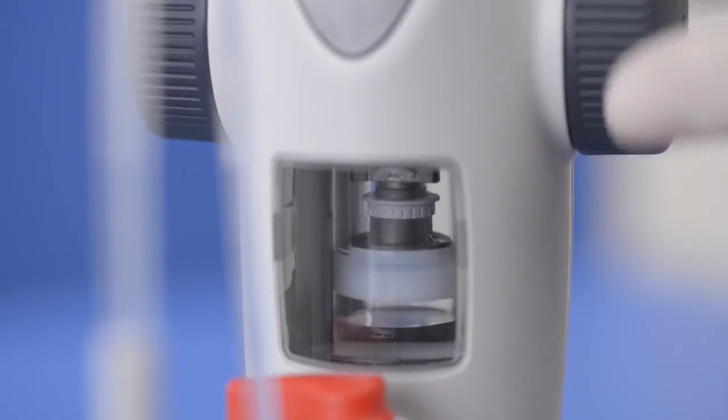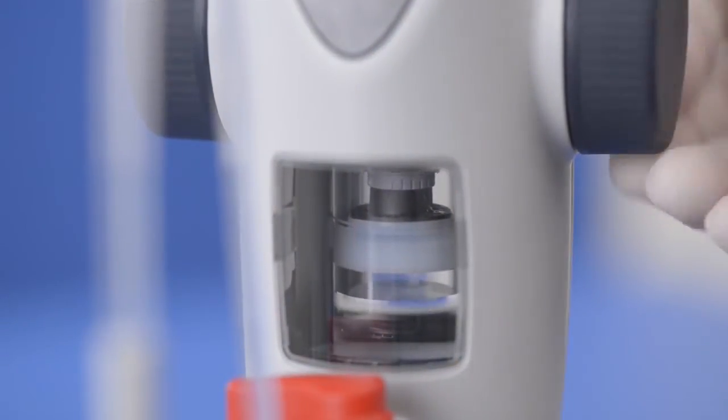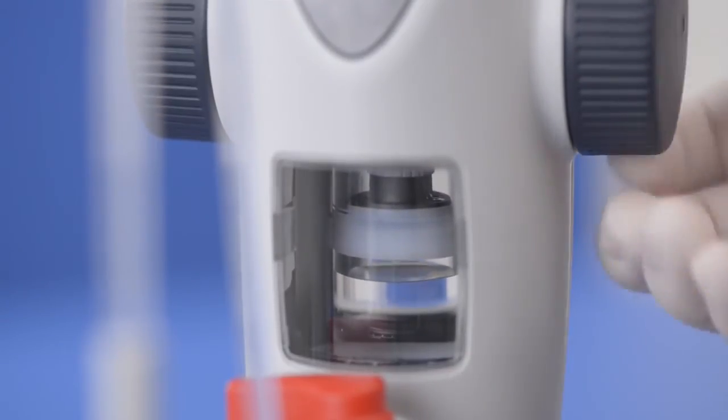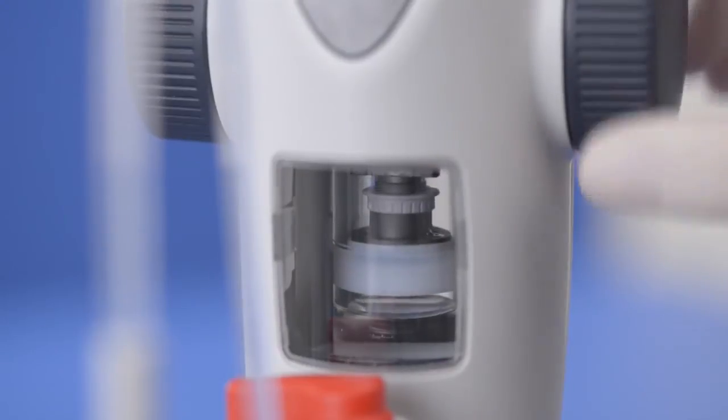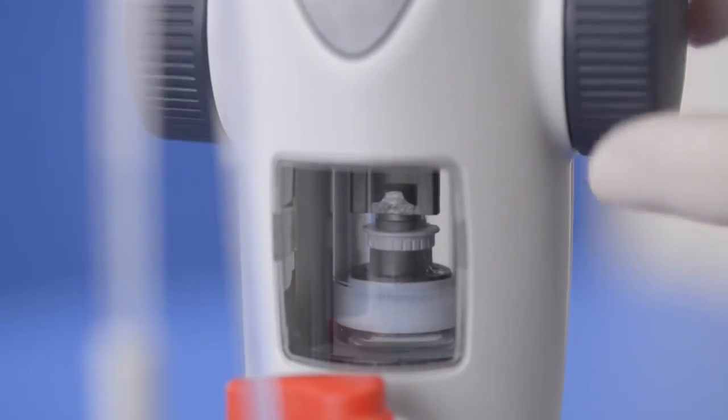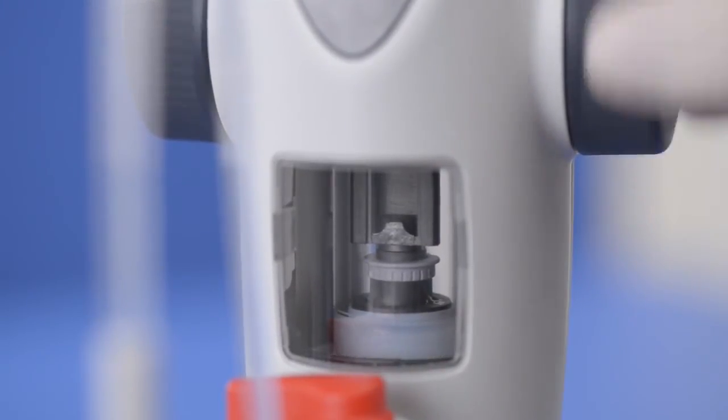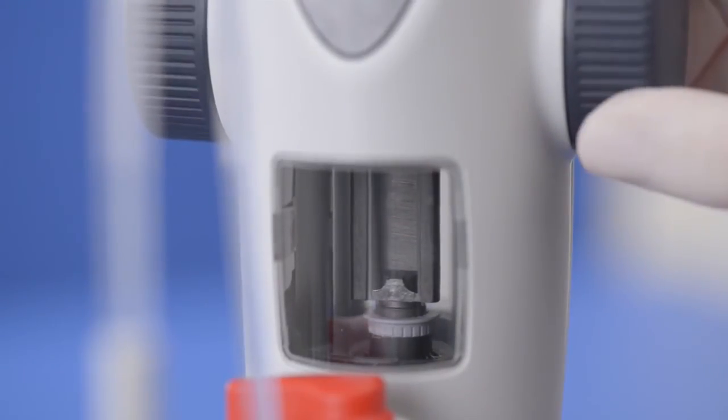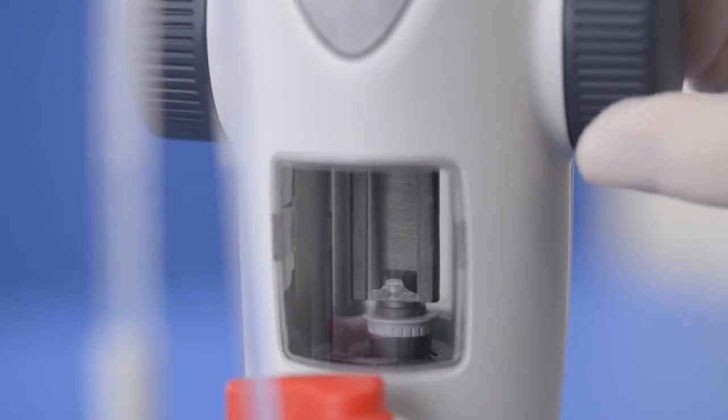To do this, turn the piston halfway up, then empty it again. Then fill with liquid with a half turn and empty it to the stop in a single stroke.